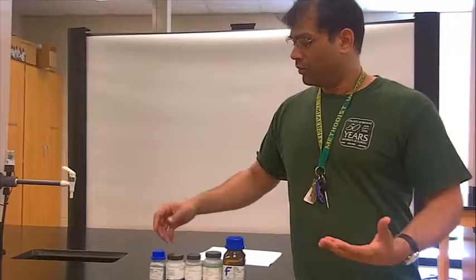In this lab, you will determine the density of various metals. From that information, you will try to determine the unit cell dimensions of the metals. The way the atoms pack to one another is essentially the unit cell. I liken it to bricks in a brick house. And from that unit cell, you can get the unit cell edge length and the volume of the unit cell. So in turn, the volume that the unit cell occupies when these metals arrange to form their metallic array.